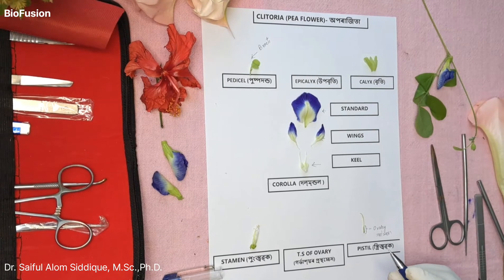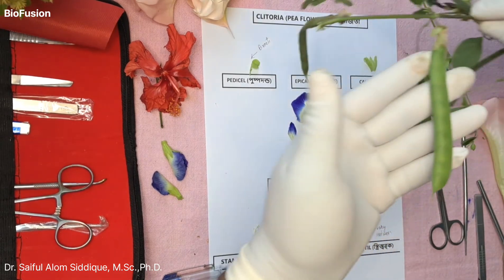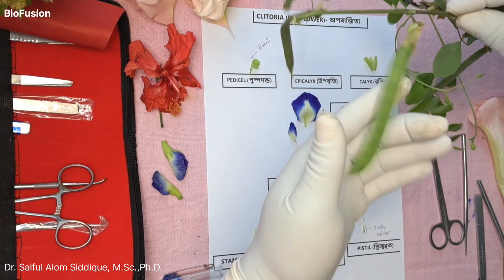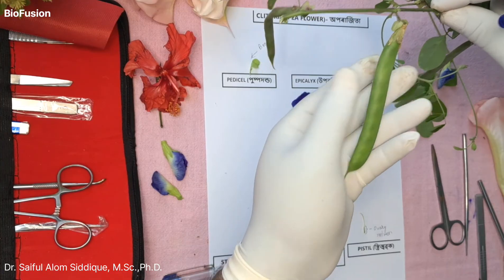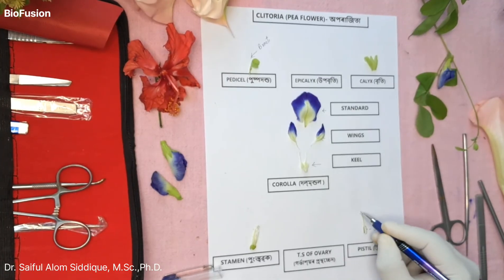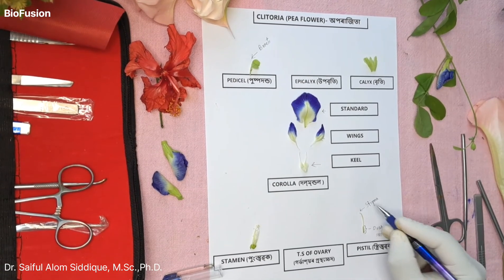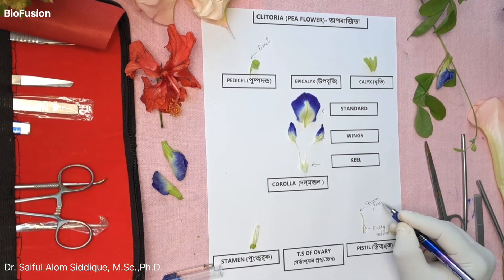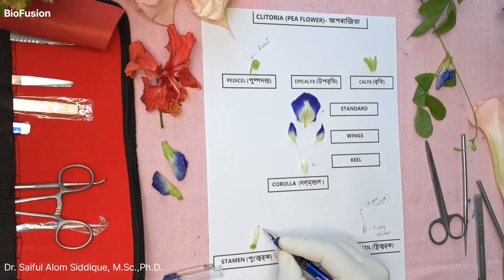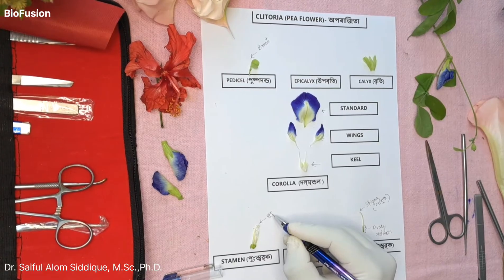So it is a marginal placenta. It is a marginal placenta. So it is a stigma — it is a stigma. So it is a marginal placenta.